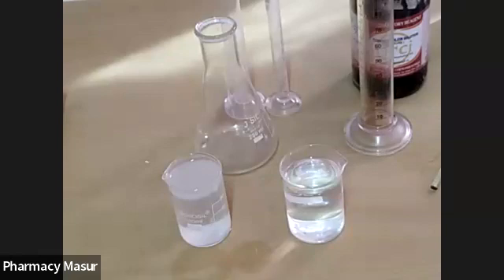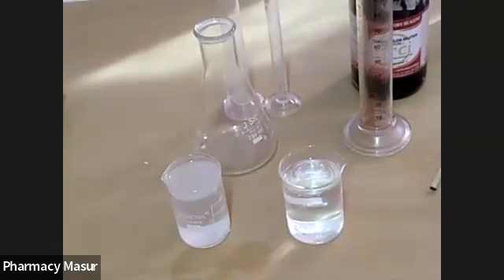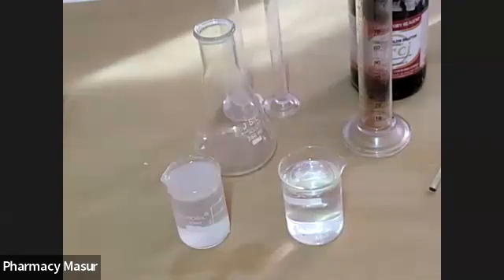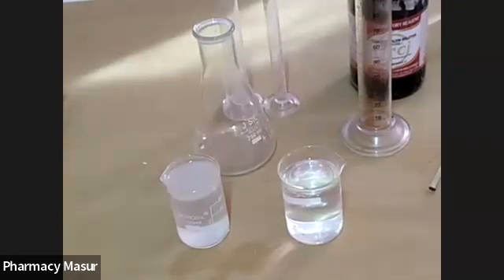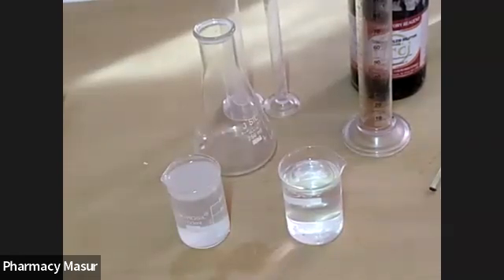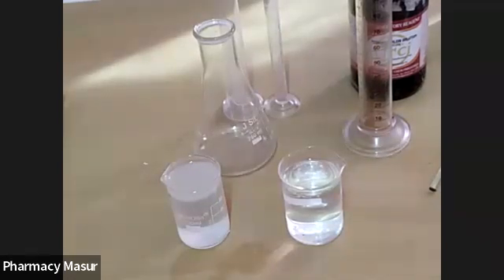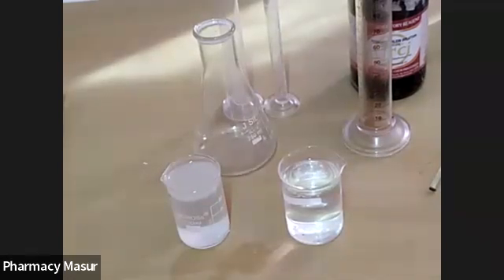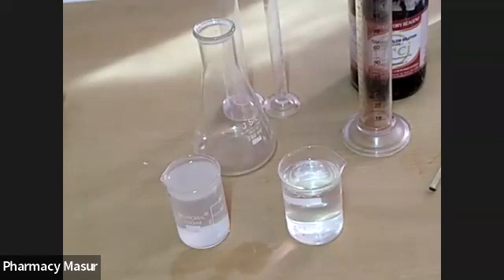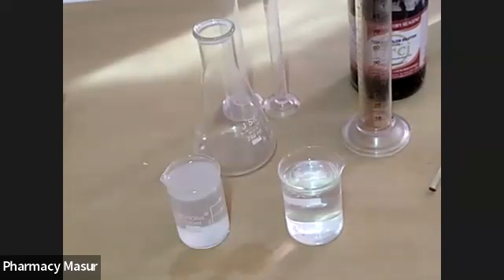As per our requirement, we have prepared the two solutions of NaOH and KHP. These are the two beakers. The left-hand beaker contains 0.1 normal NaOH solution and the right-hand beaker contains 0.1 normal KHP solution.